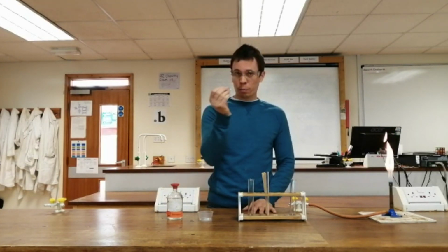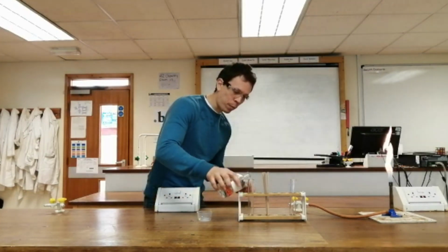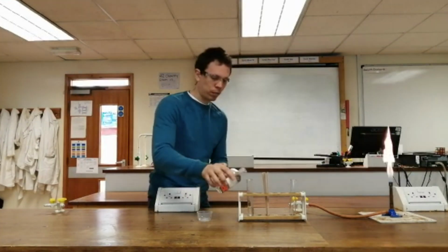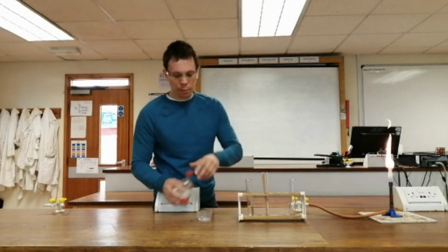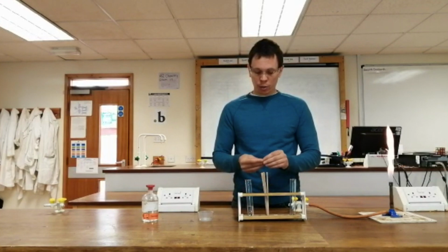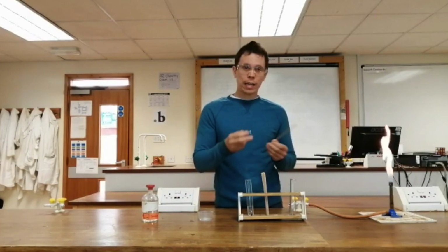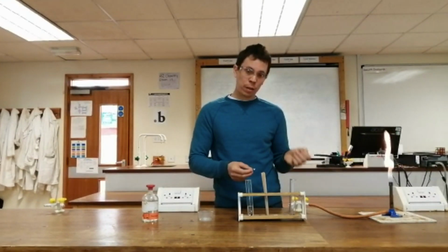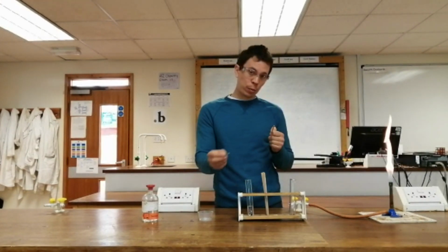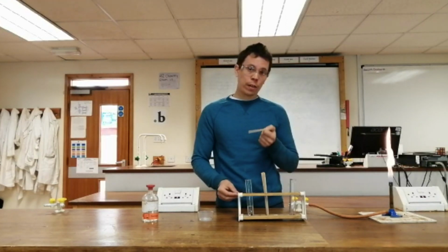Now, acids and pure metals always produce a salt and hydrogen gas. So if I pour some acid in first, once I drop my piece of magnesium in, it's going to start to fizz, and that fizzing is going to be bubbles of hydrogen gas being produced. Now, this is similar to the test for oxygen, except this time I want a lit splint, not a glowing splint, but an actual lit splint, one that's on fire. And I'm going to pop that into the gas that is produced between the reaction between the metal and the acid. And if it's hydrogen gas, it should give a squeaky pop.